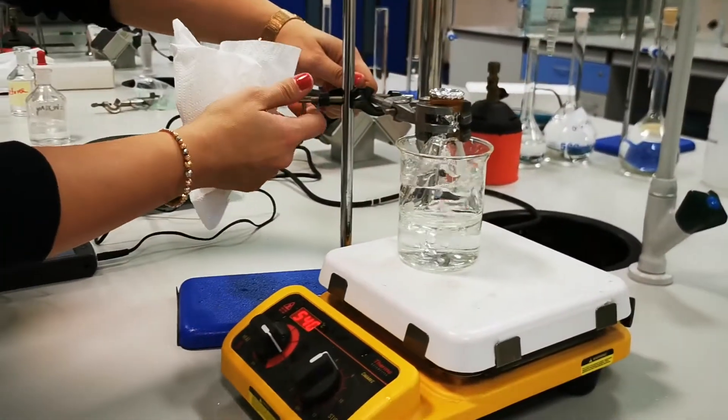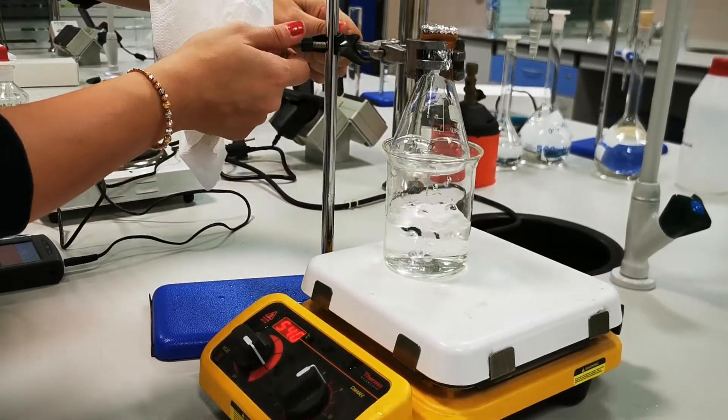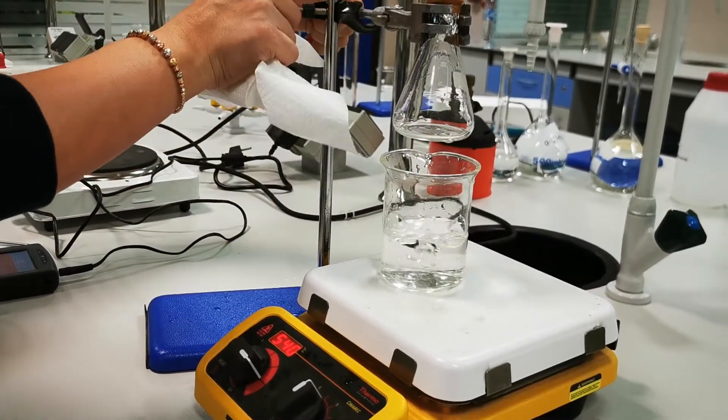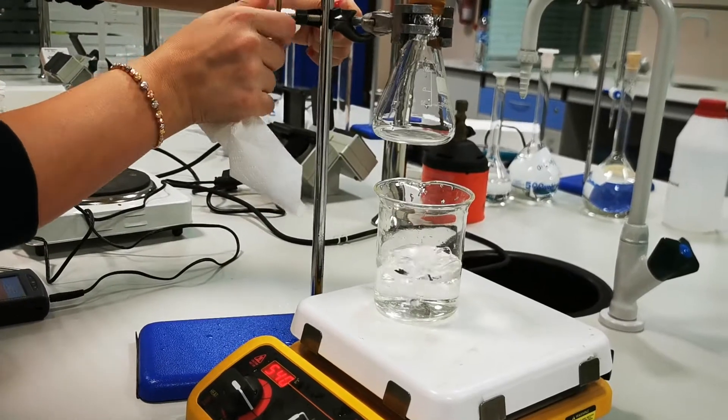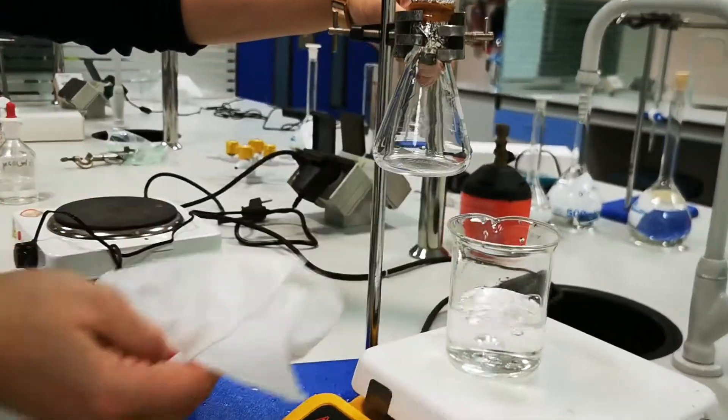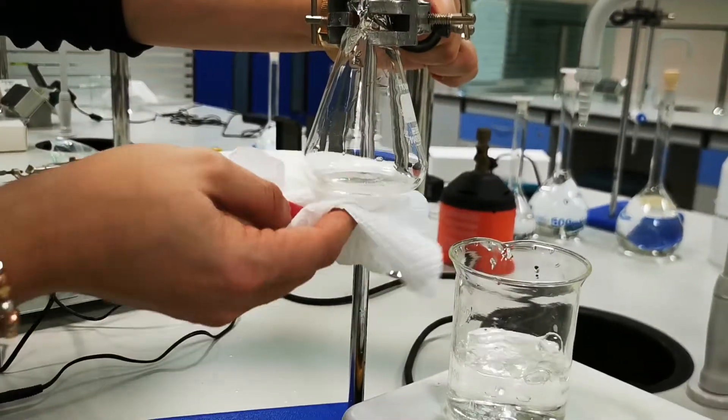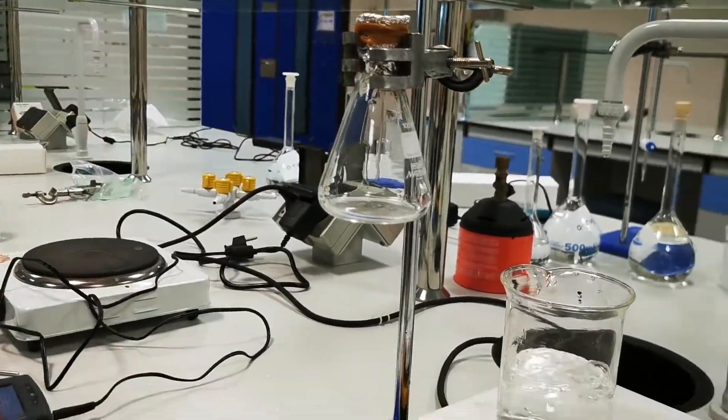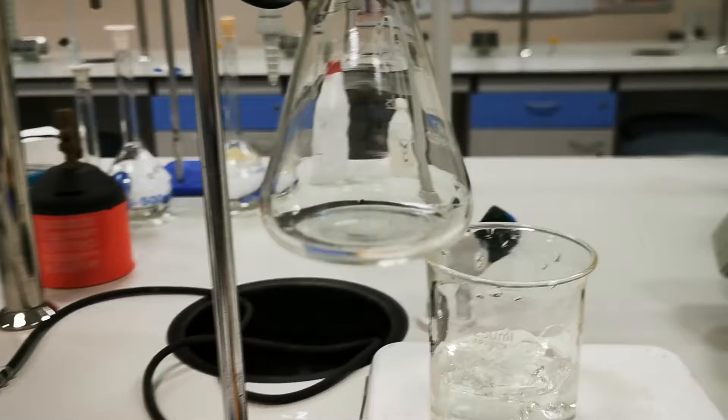Now, I'm going to try to remove the flask from the boiling water, to see if all the liquid evaporated. Just know that... Let me see here... Yeah. So, I can see that all of the liquid evaporated.